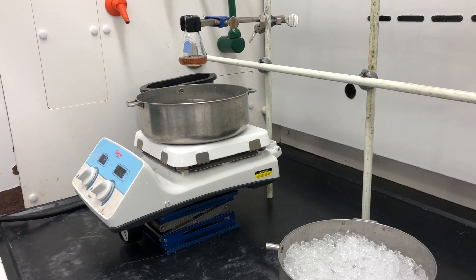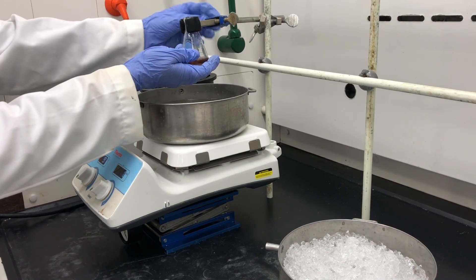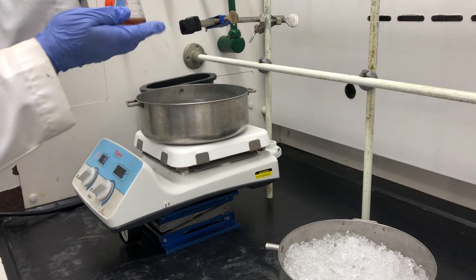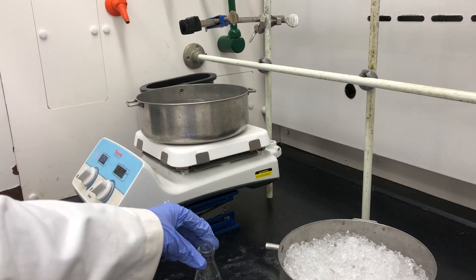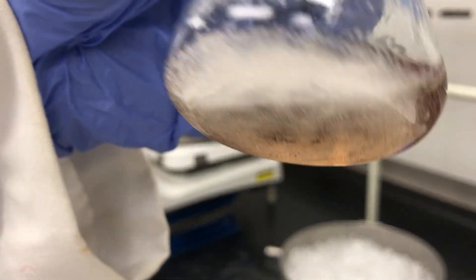Now that we've allowed it to cool for some time, I'm going to take it out and place it on the bench top. Once it reaches room temperature, I'll go ahead and put it on the ice bath. If you take a look, you can already see the formation of the crystals or the product.